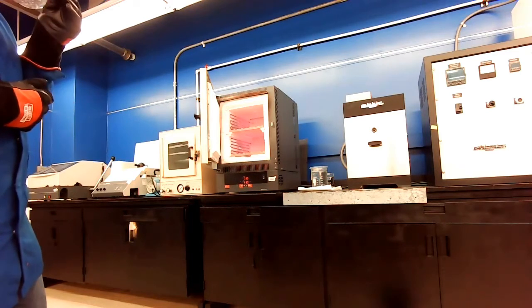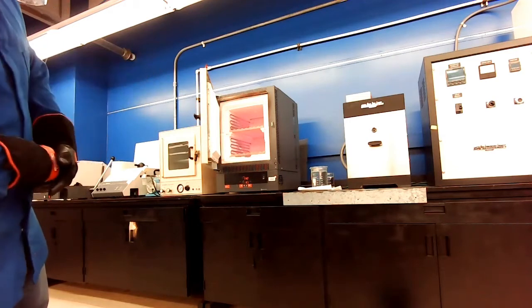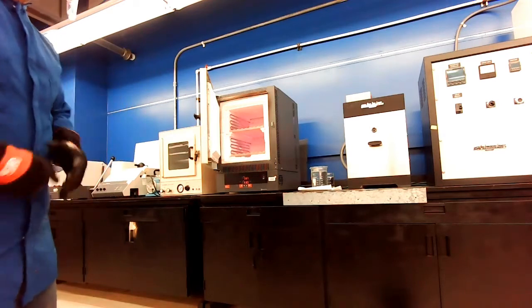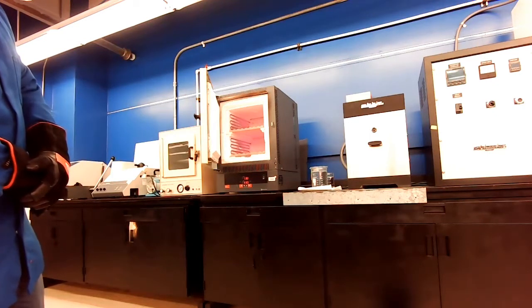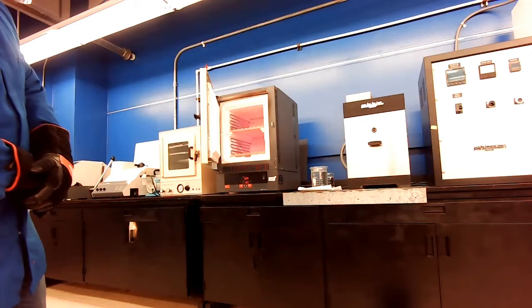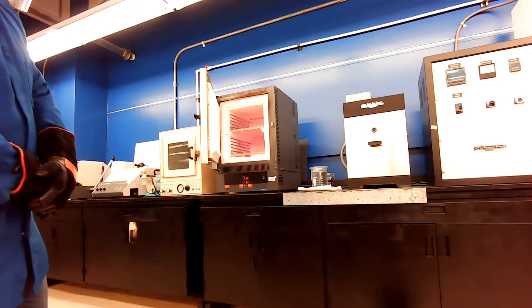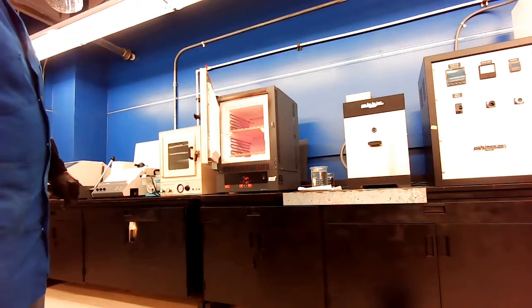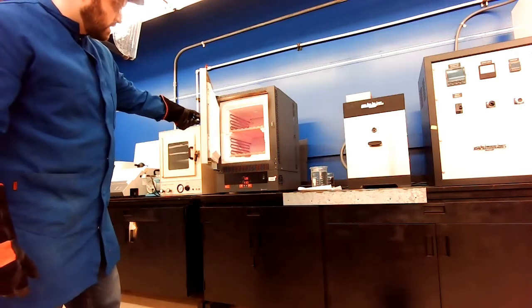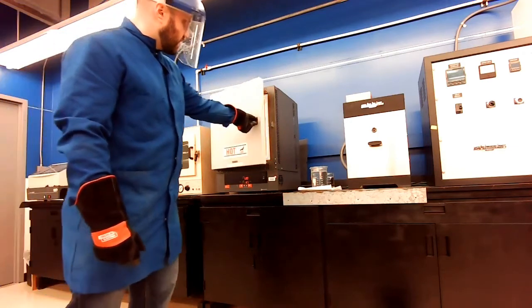So we're at about 750 in the furnace. It's a little bit hard to see on this camera, but in the back left, there's a thermocouple there, which is reading out that temperature. So it's telling me what it is inside of that area. All right, so we're at about 700. So once we get below 700, I'm going to close that back up.